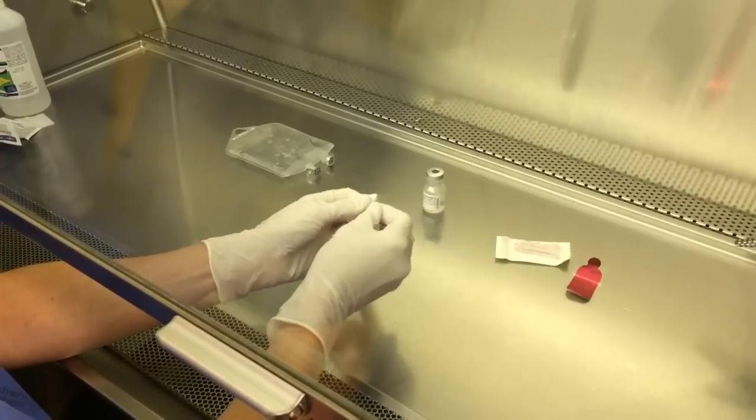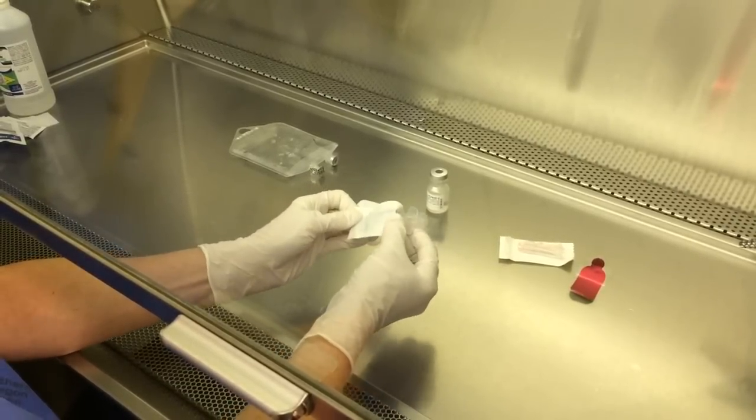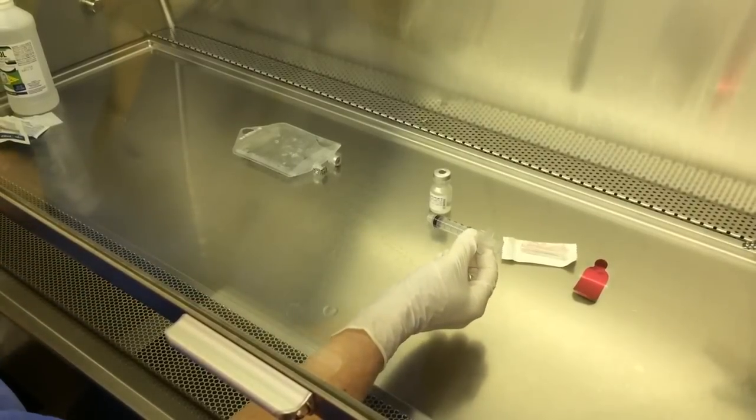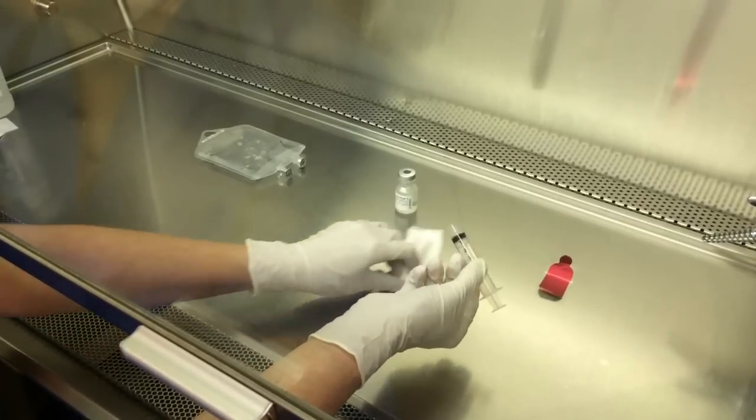Peel back the paper on your syringe, taking care not to touch the inside of the plunger or the tip of your syringe.